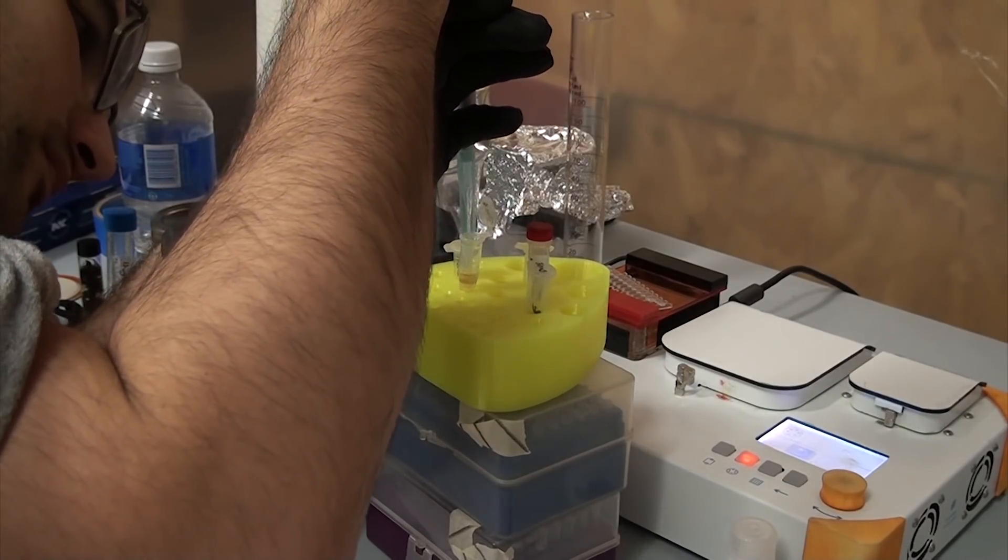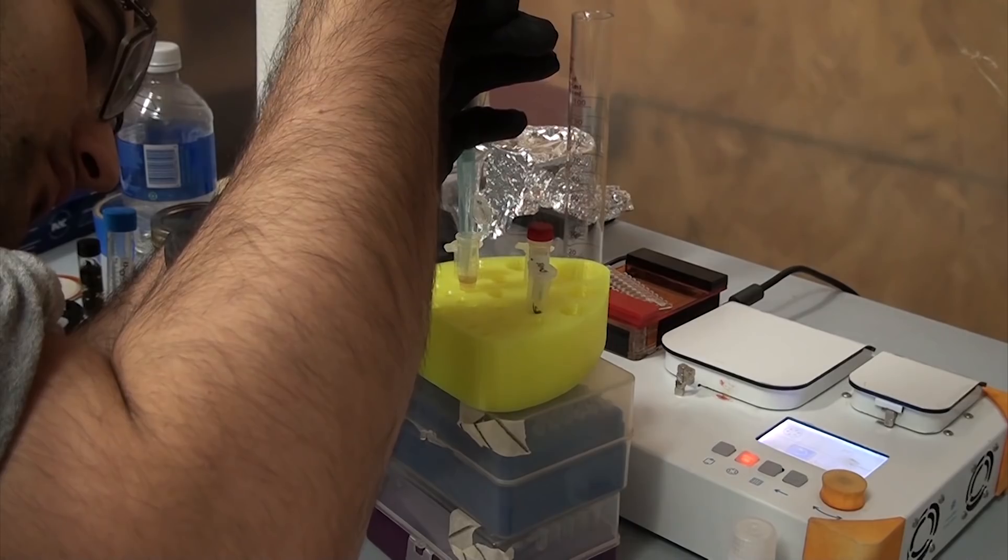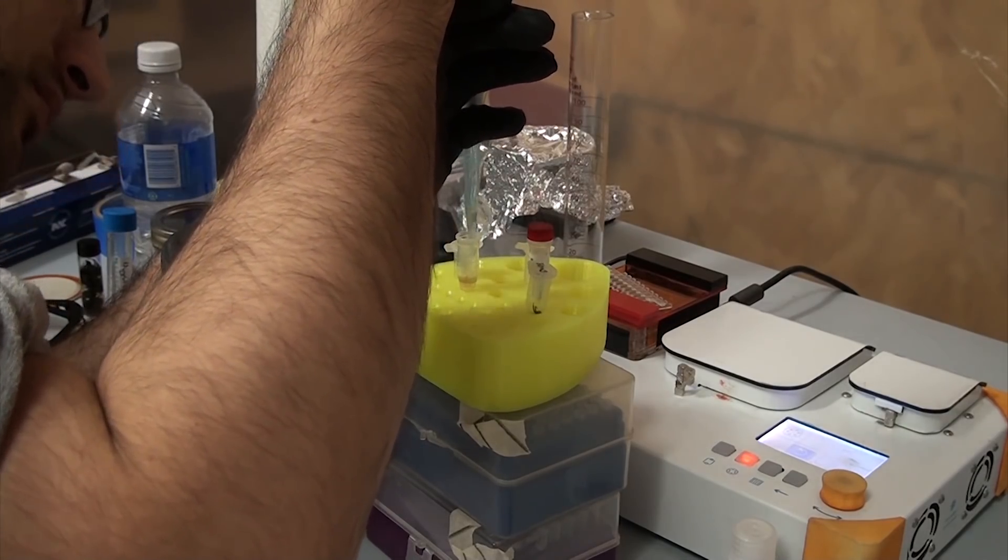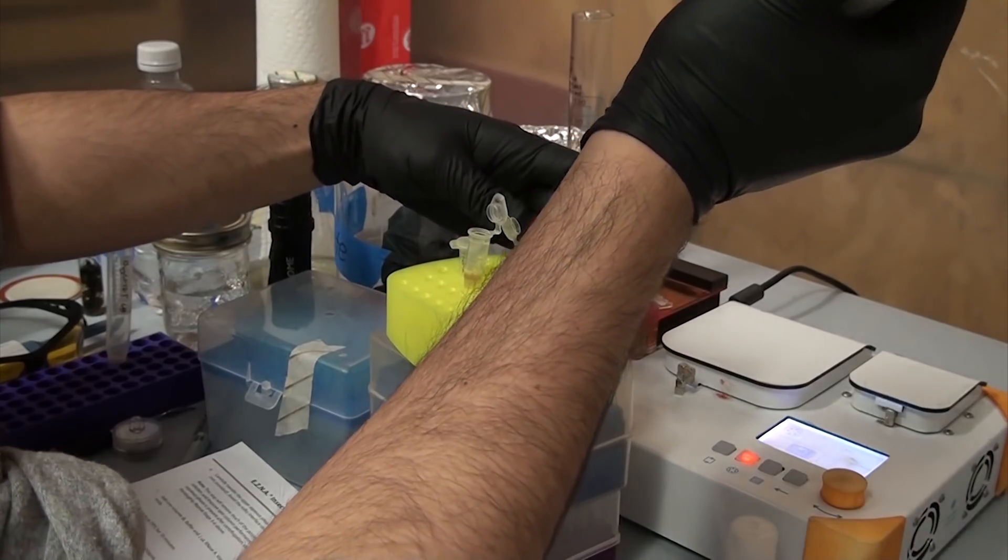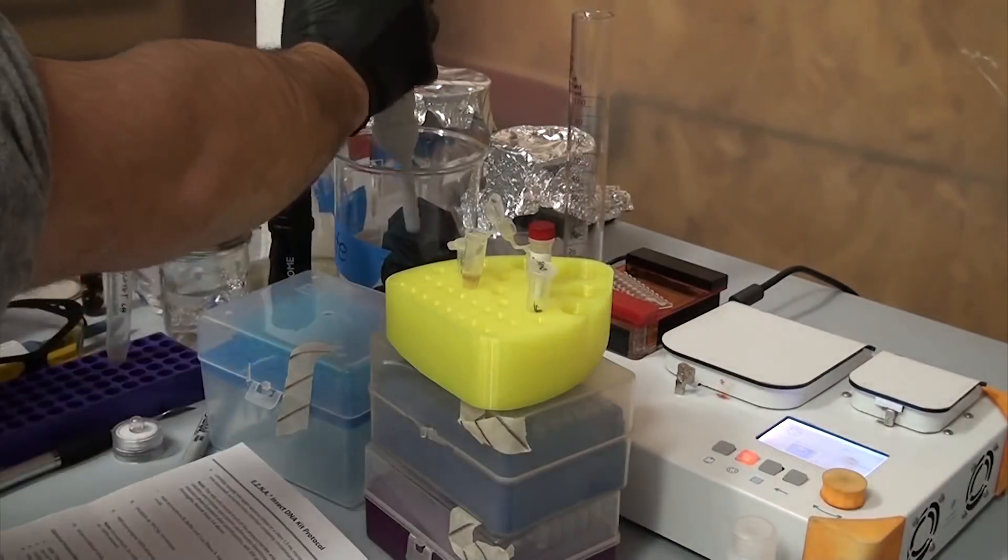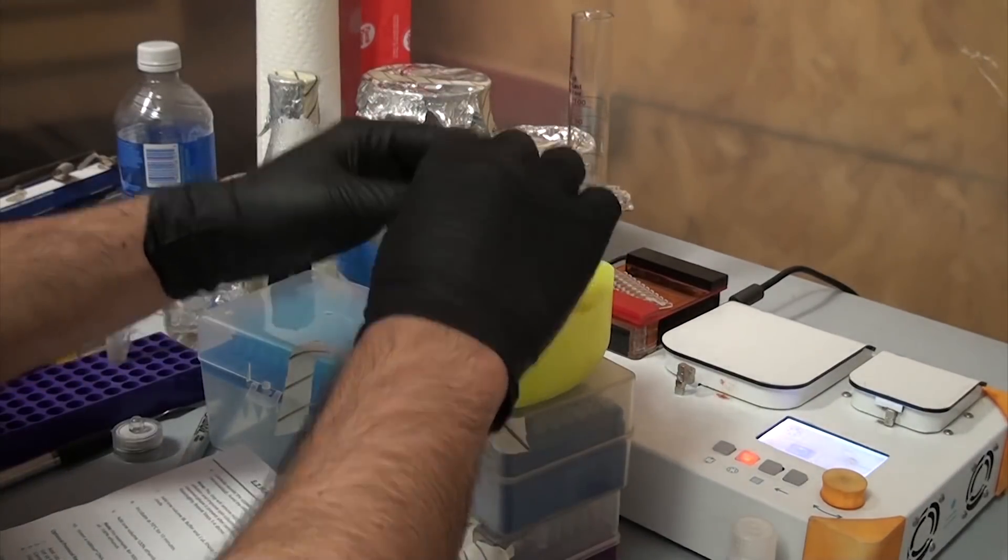I ended up making a stack of stuff so that I could get this at eye level to make it easier. Not great lab practice, but I wanted good results. The top aqueous layer is transferred to a fresh, sterile 1.5ml tube for further processing, being careful not to disturb the debris.